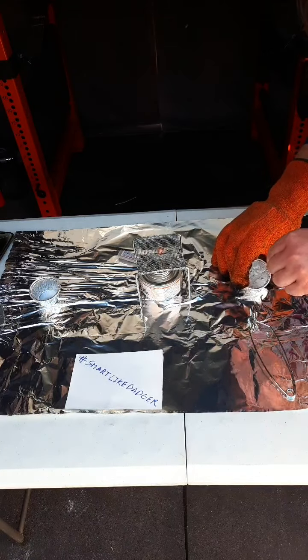So Boris used a glass stirring rod to try to crush it up, and maybe get out trapped water. Now this already sounds and feels like something that is drier, like something that has lost its water content, which is an observation we can put down in our journal. We crush, we crush, we crush.